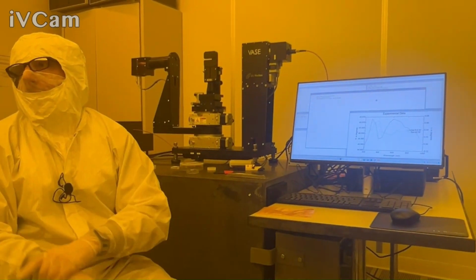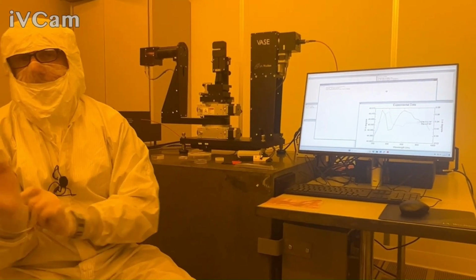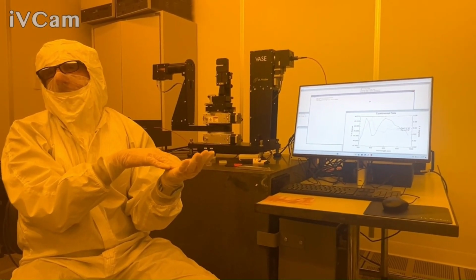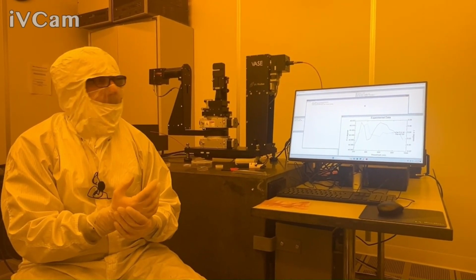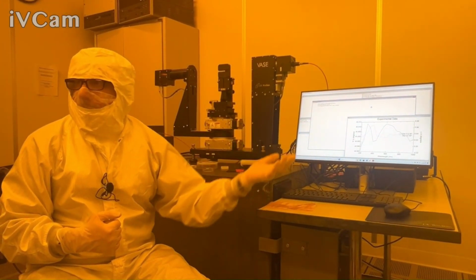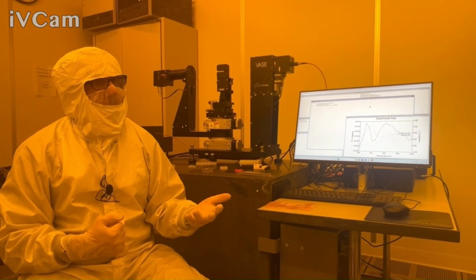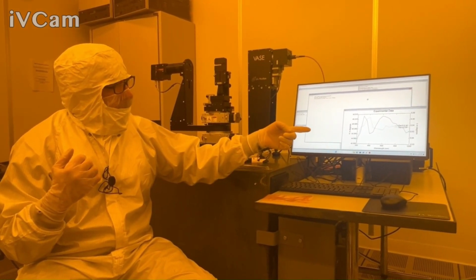That comes into play if you're looking at things on glass for sure, because delta is usually close to 0 or 180 for transparent films on glass, the most common example. Right now I'm using the auto retarder. Measurements will be faster without it, and your reflectance measurements actually will be faster too, because we just need to see what the raw intensity is. But it's just the baselining.